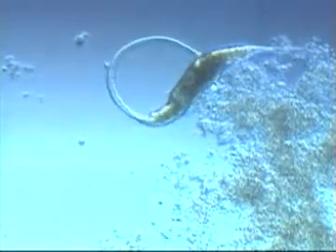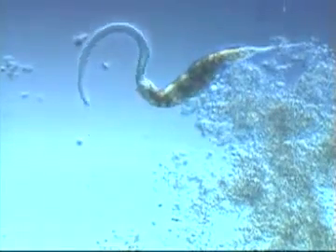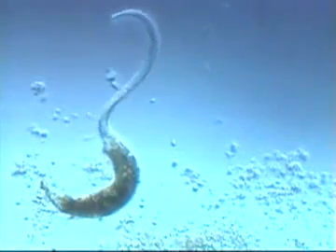Dileptus is an unusual-looking protozoan because of its long neck or trunk. It waves this through the water, directing food toward its mouth, located here at the base of the trunk. Dileptus feeds mostly on bacteria and tiny protozoa. Another protozoan with a long neck is Lacrymaria olor, sometimes referred to as the swan because of its resemblance to that bird. It whips its neck in and out of pond debris, searching for food.